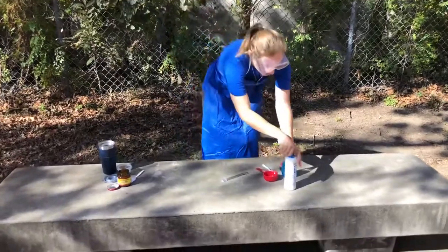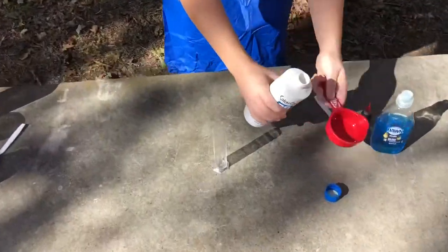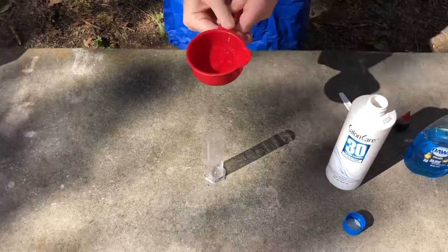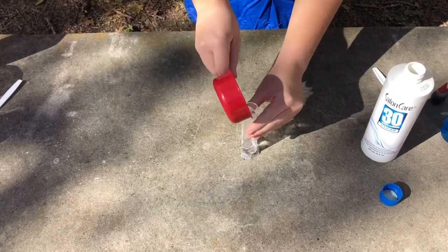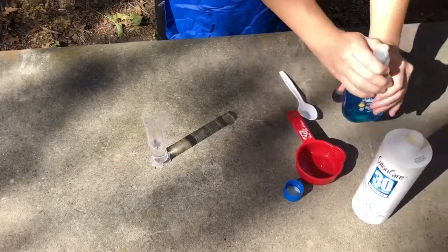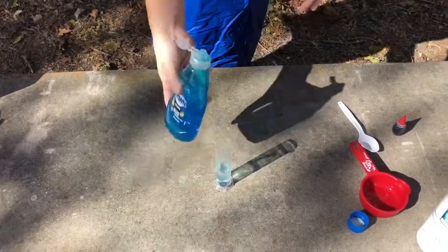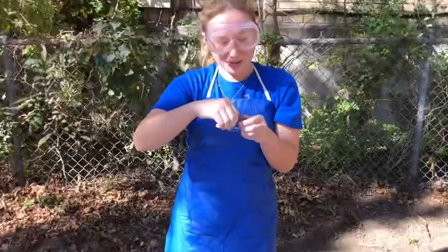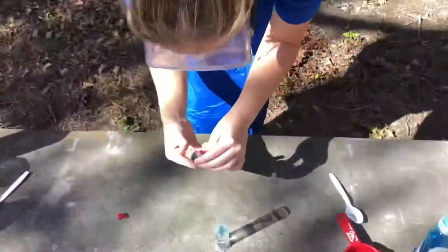We're going to start off with 1/8 cup of hydrogen peroxide and put it in our beaker. Then we're going to add just a squirt of dish soap and food coloring, because who doesn't love food coloring — we're not lame up at A&M.